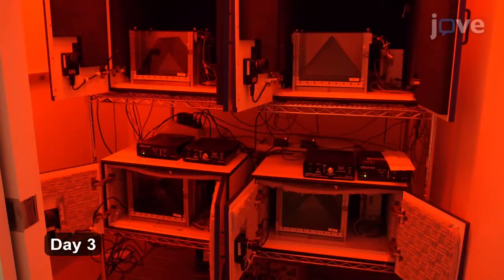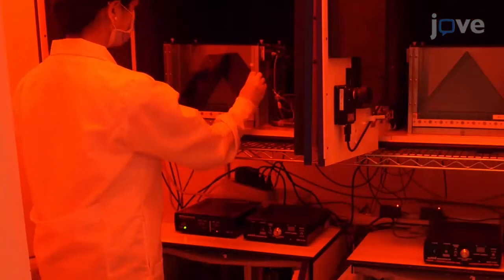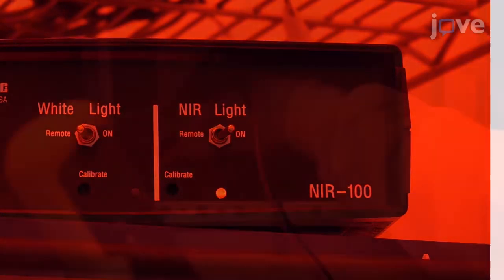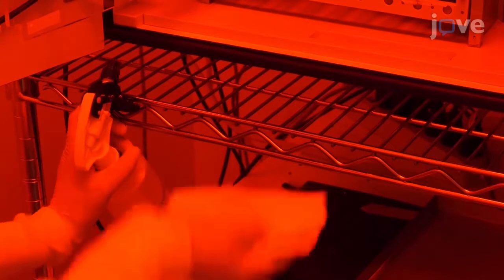On day 3, set up context B with a different set of grid floors from the ones used in context A and black triangular or white curved plexiglass inserts. Use infrared or near-infrared light if necessary to illuminate the chambers, and check the shock amplitude with the multimeter. Wipe down the chambers and spray the pans beneath the grid floors with the solution not used in context A.